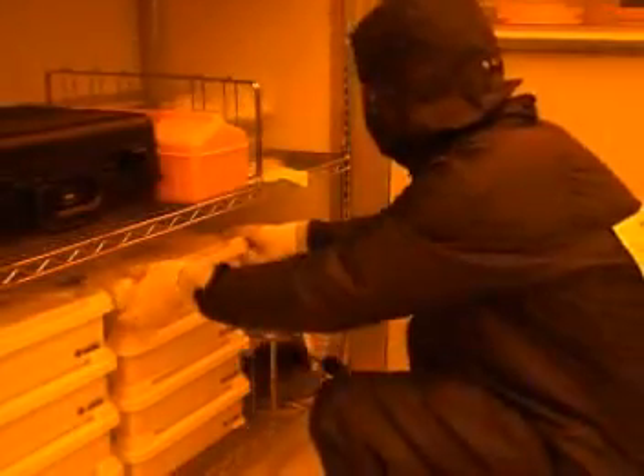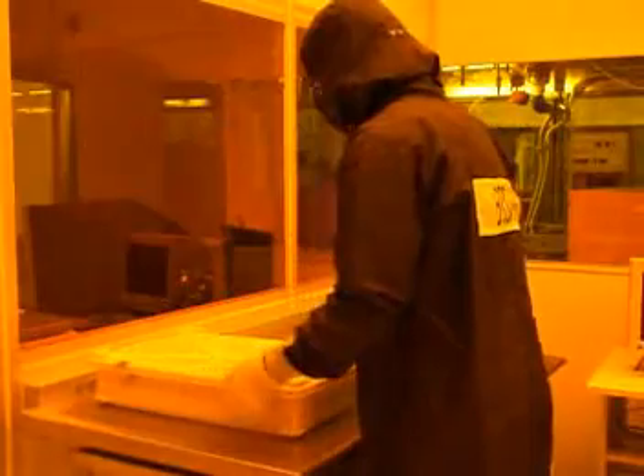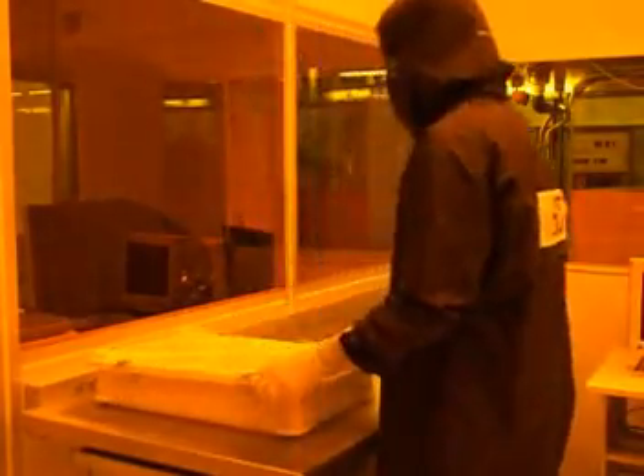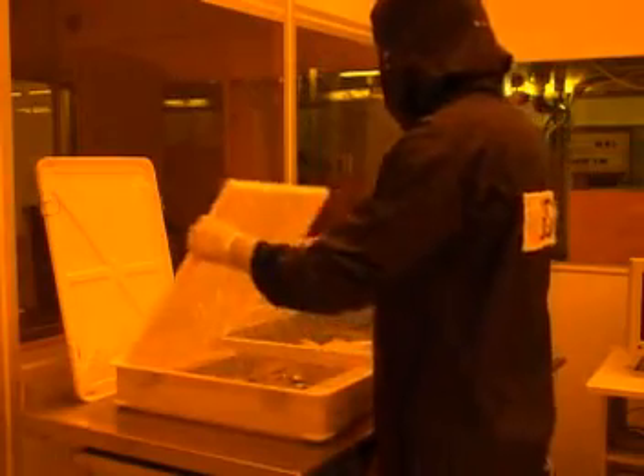All the wafer cassettes are contained in plastic boxes on the metro shelf and in the main column room. Each of the boxes are labeled with the cassette size. You should select the box containing the cassette that you need. Carefully place the cassette box on the stainless steel table. Undo the clasps on the outside of the container box, take the top off and put it aside. You should also remove the foam cover on the inside of the box and place it aside as well.